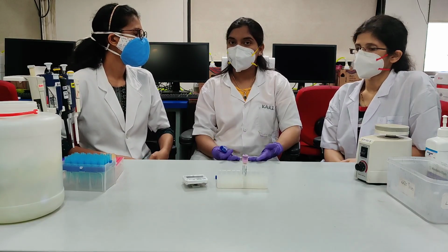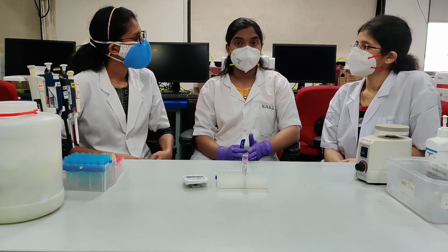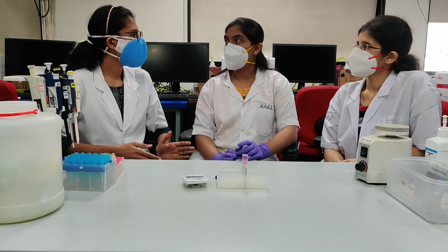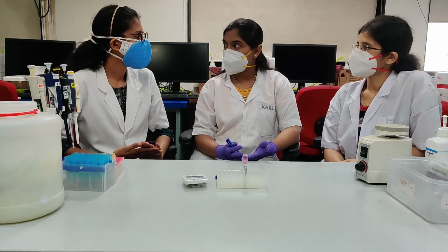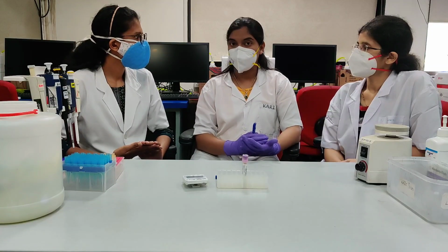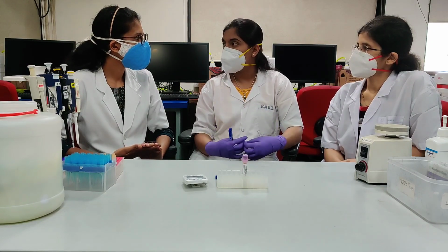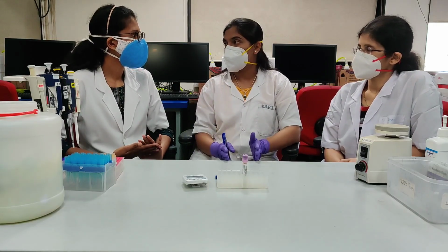Before we proceed to sample processing, we will discuss some basic concepts to be familiar with. We use the stain, lyse, no wash method for CD34 stem cell enumeration. But why are we not performing a wash after lysing? This is a quantitative assay. We calculate absolute counts, so we require a fixed concentration of beads and sample volume. If we include washing steps, you will lose your beads and sample, which will directly affect your absolute cell count.